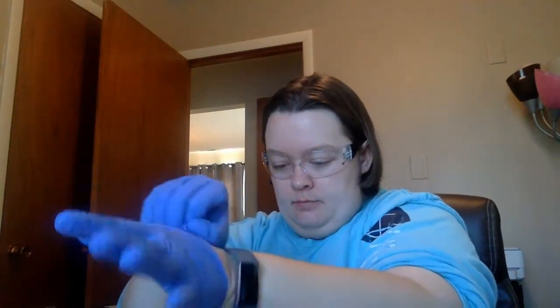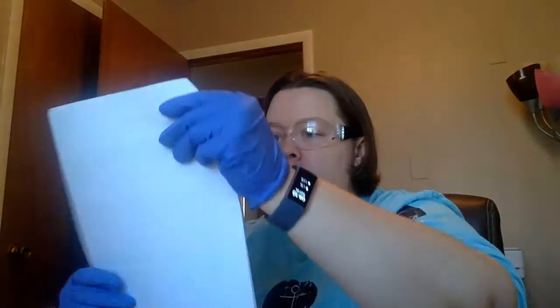by charge. So again, I want to be safe as we do this. So, put on my gloves. Alright, so our first step, let me turn you here.